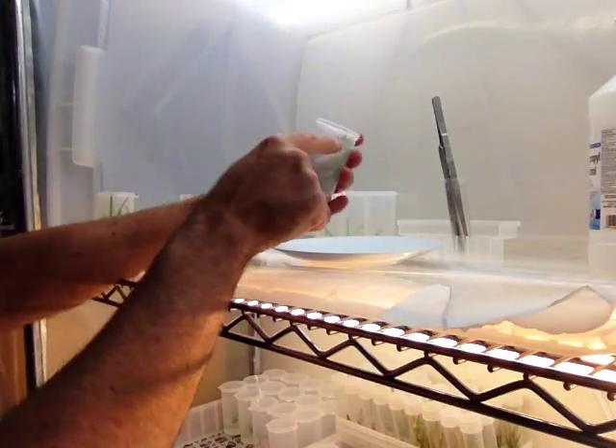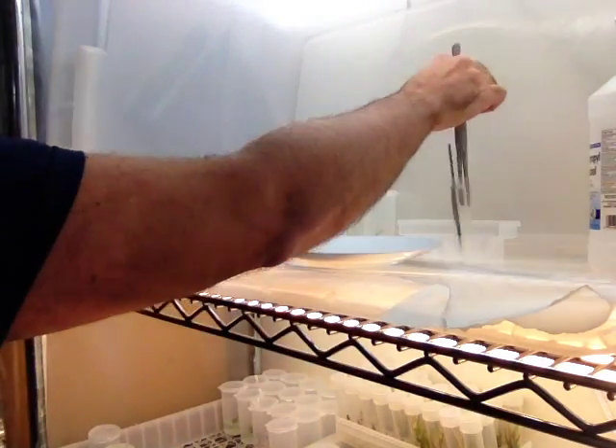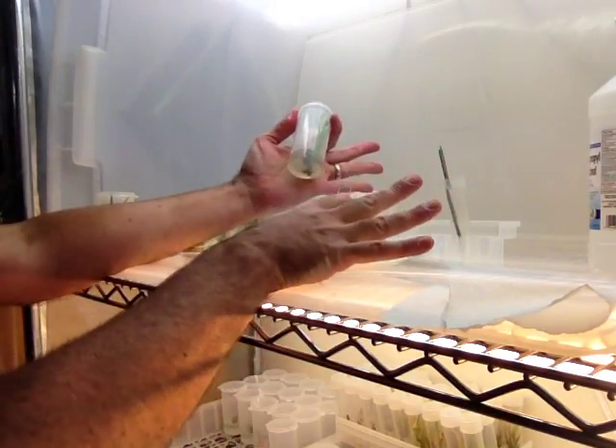Just make sure there's no mold spores around the lip. When I open it, I don't want any dry spores in there to be able to sort of swirl in. My hands, of course, are washed. I can leave them in alcohol.